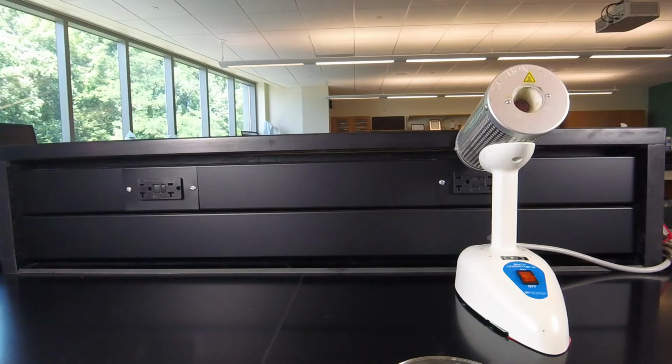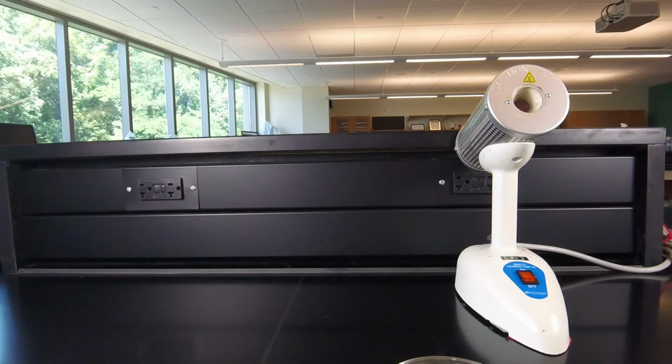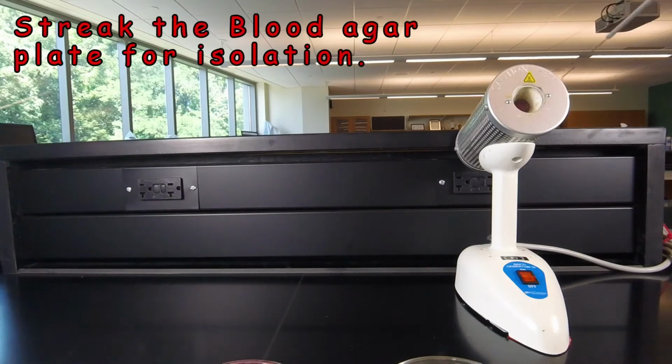One of the tests we're going to use in today's lab to help identify a bacterium as a Staphylococcus is blood agar with a Novobiocin or NB disc. So in this video lesson, we'll show you how to inoculate the blood agar plate and place the Novobiocin disc on the plate. So we basically streak the plate for isolation.